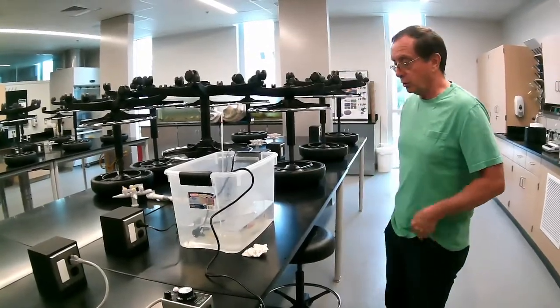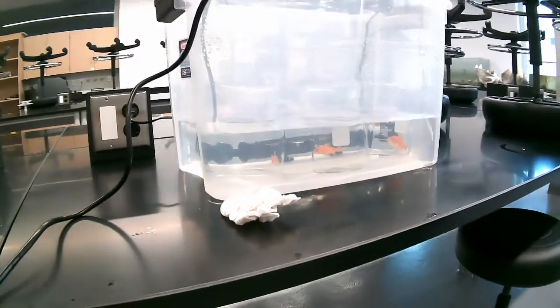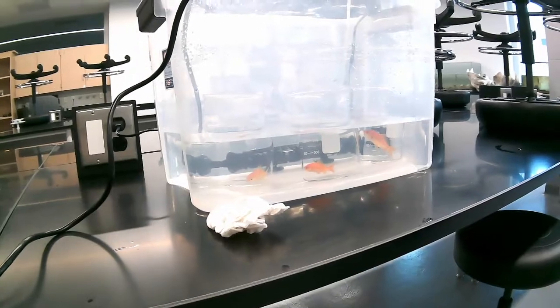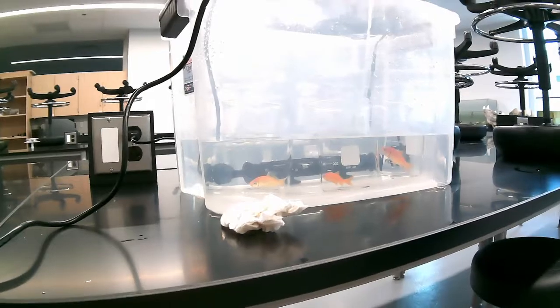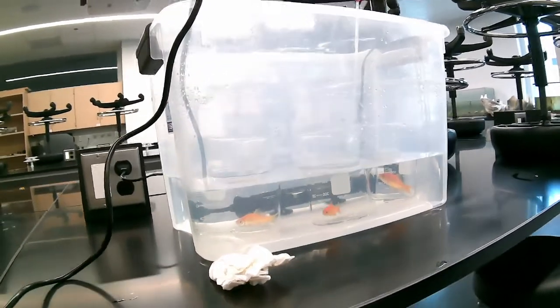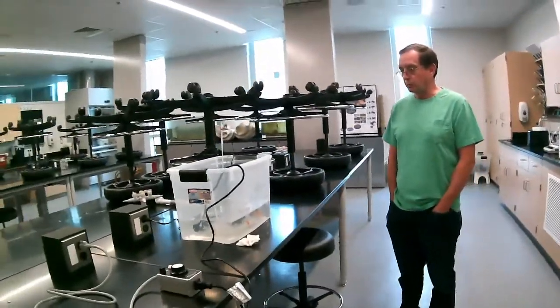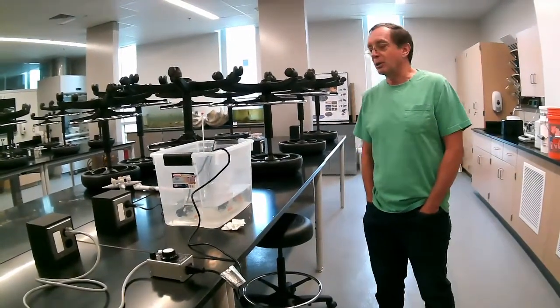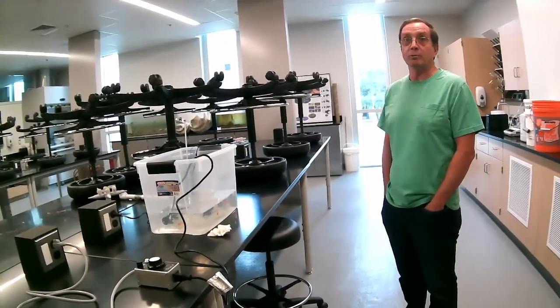If we take a look at the fish in there, we see that they're relatively calm and collected. They don't seem to be in any distress. It's always good to include a description of the progression of behavioral changes that you see in the fish or the crab or whatever animal you're working with. Remember, this only works on ectotherms. It doesn't work on homeotherms. So this is a really good test. There are thousands and thousands of fish species and also crab species. Just about any ectotherm you can think of, somebody's done a critical thermal maximum study on it.